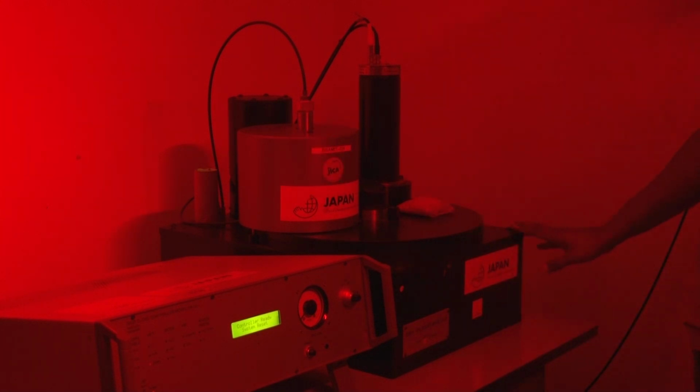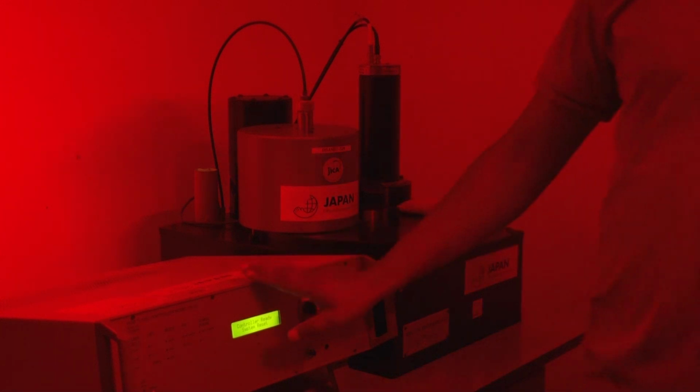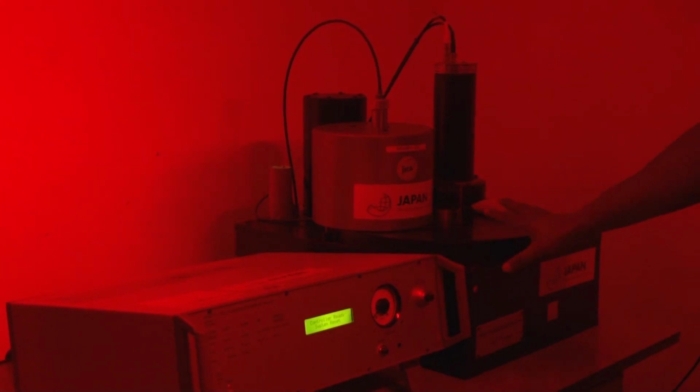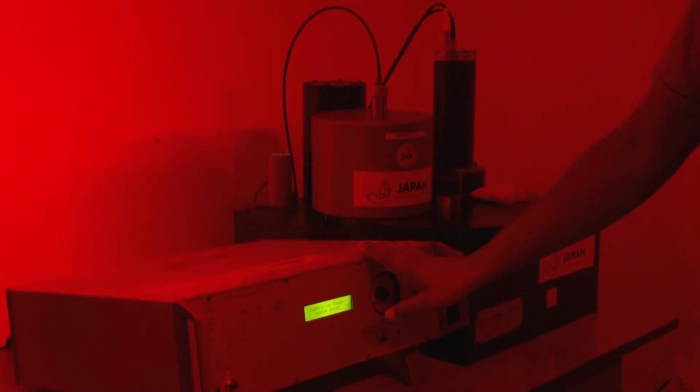And one heating plate has been given over here to give the temperature to your sample. This one is the controller. All the processes assigned to the reader are controlled by this controller.